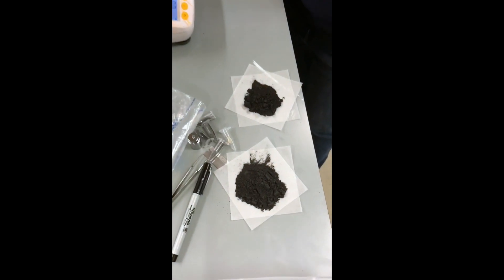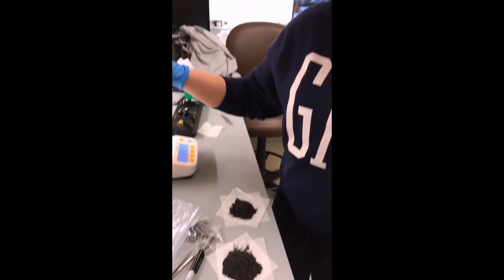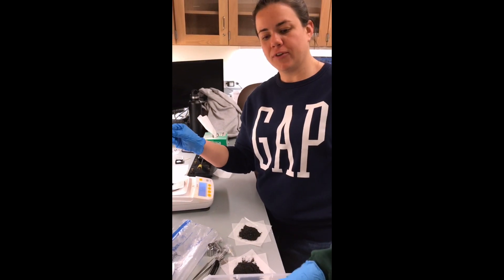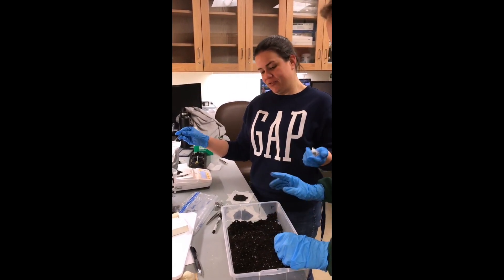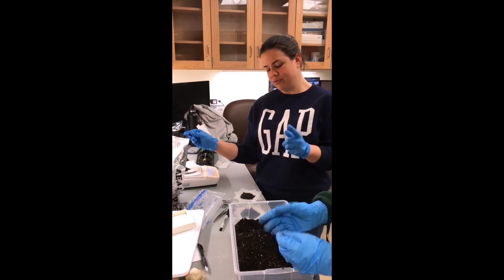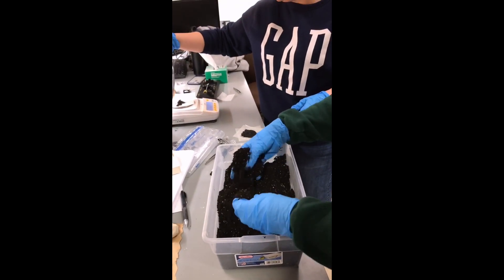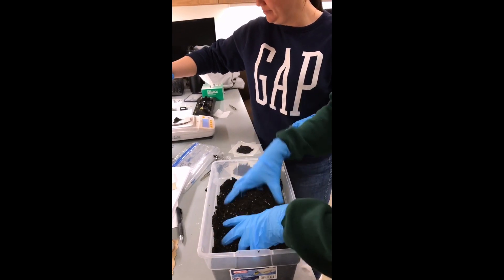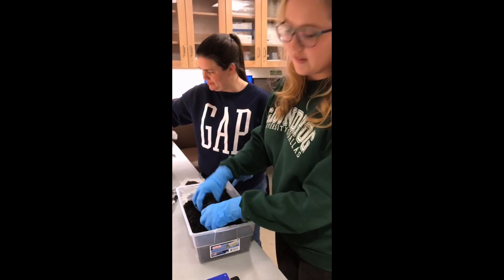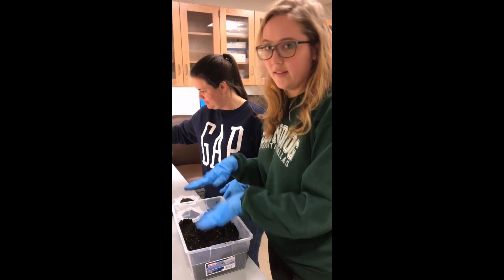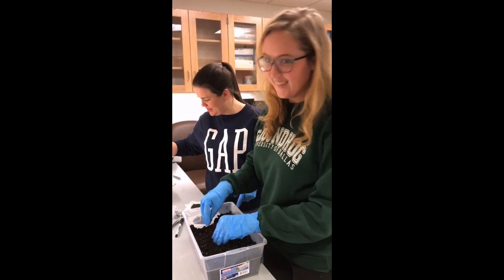The next step is to prepare the soil to bury the bones. Right now we are measuring out portions of hematite, this is pure hematite, and we've decided to make our samples contain either 5%, 3%, or 1% hematite. So in order to match the 1,000 grams that we have in the samples, right here we have 50 grams, or 5%, of hematite added to the soil mixture. What I've done is I've just dumped the hematite in, and I'm mixing it up right now, trying to create a good dispersion of hematite into our soil so that we have a more or less homogenous mixture.